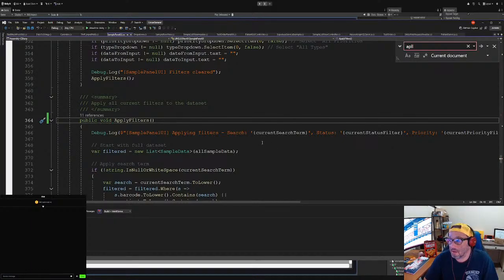And the only time you really need to make it private is if it's manipulating data. Here you just get data, so that shouldn't do anything. You wouldn't have to worry about the hacker issue. Okay, all right. And also make these dates uninteractable because TextMeshPro. Oh no, we're doing good. Oh no, we need to change that.